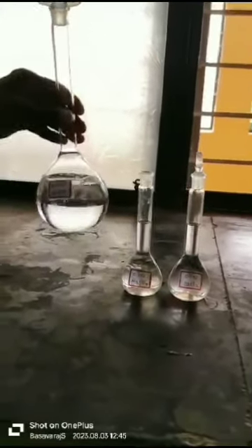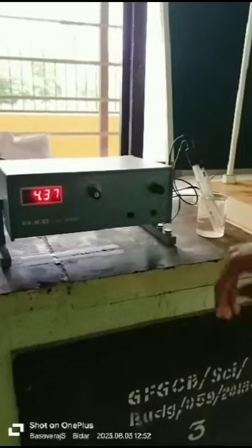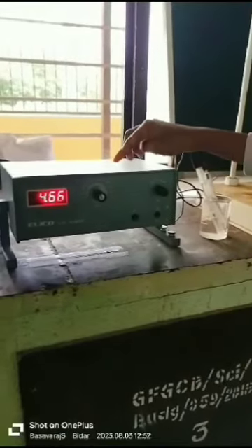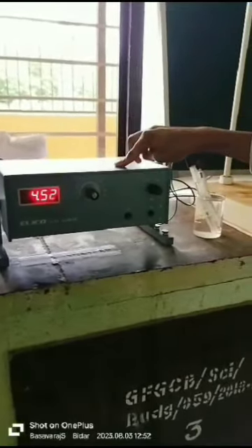Today we are doing an experiment on titration of orthophosphoric acid against NaOH by pH meter. The aim is to titrate a 0.1M H3PO4 solution with 0.1N NaOH solution using a pH meter.